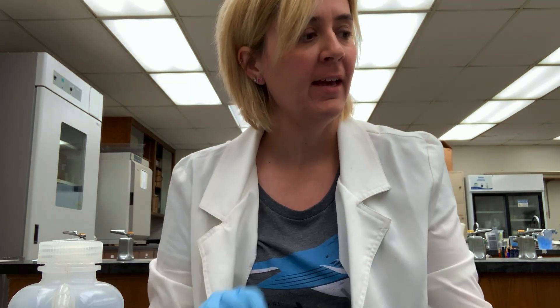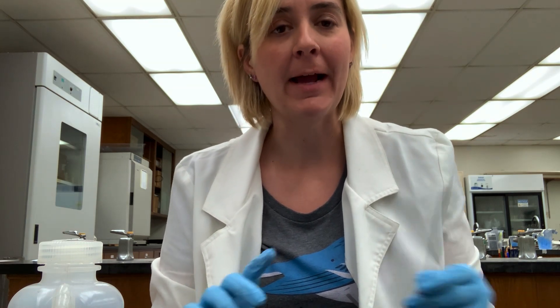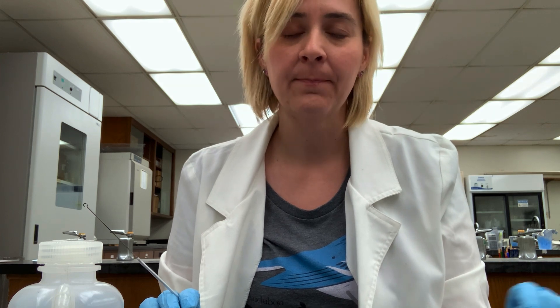The next differential stain we'll talk about is the acid-fast stain. It is useful when we have a type of cell that has a waxy coating surrounding it. That waxy coating is made of a substance called mycolic acids, and unfortunately the presence of that waxy coat really interferes with the gram stain. So scientists have developed a novel stain to deal with these waxy bacteria that have mycolic acids.